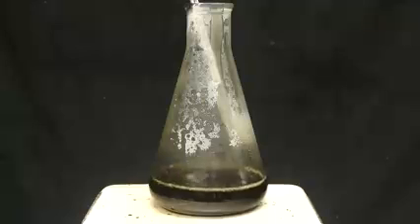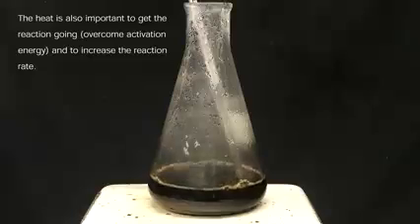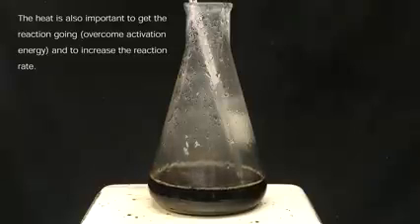The major way that we're getting around this is by doing the reaction at a really high temperature. At nearly 200 degrees Celsius, any water that forms will be almost immediately boiled off. Without the water, the reaction can't go backwards, and everything should slowly be funneled to the products.